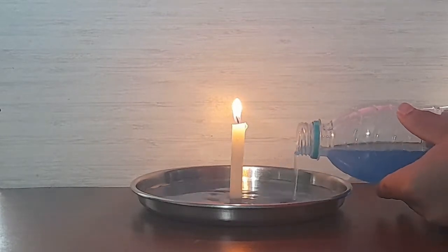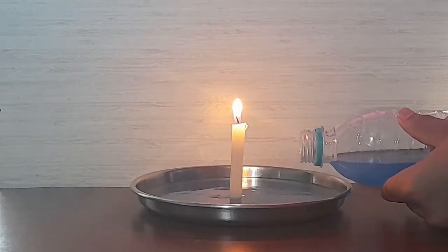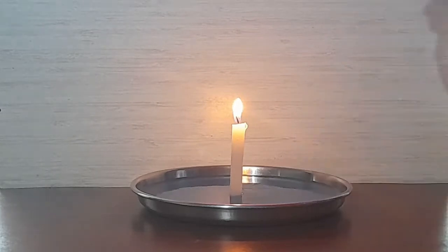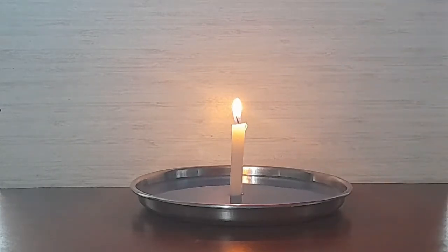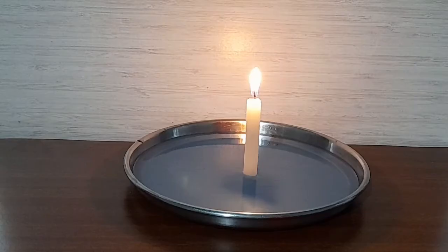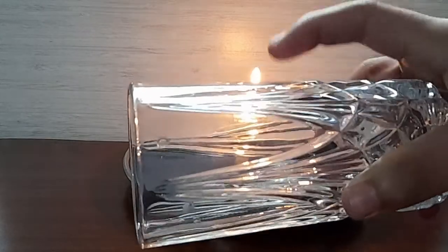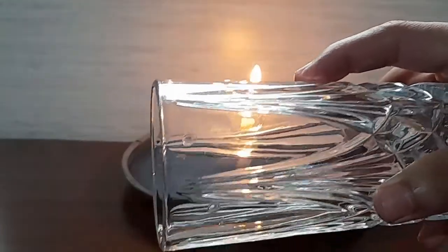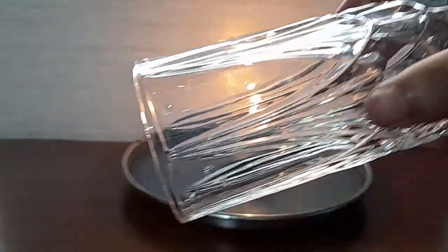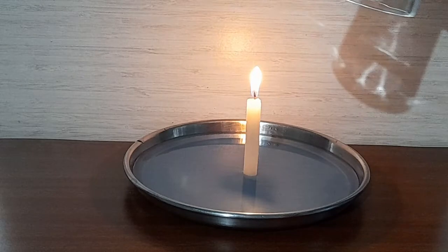Now take a beaker and place it upside down on the plate.